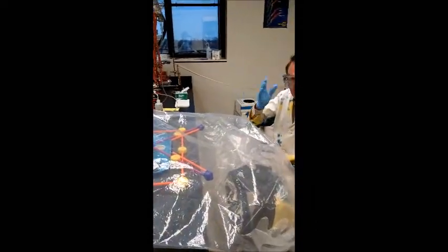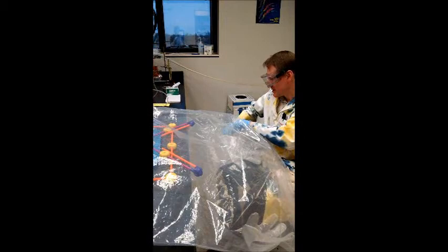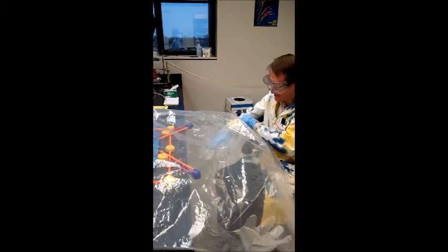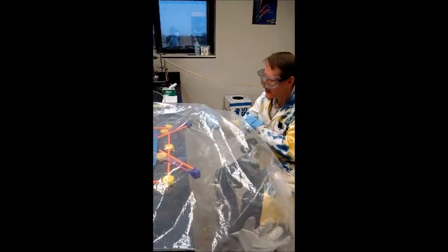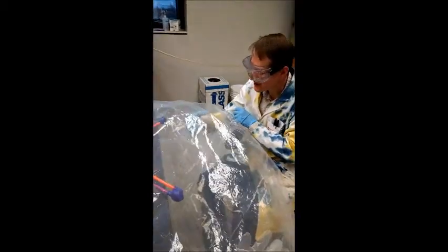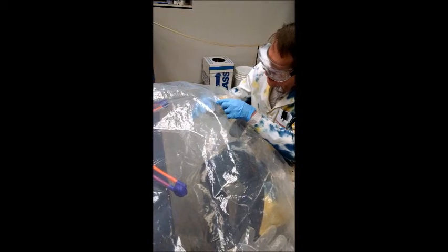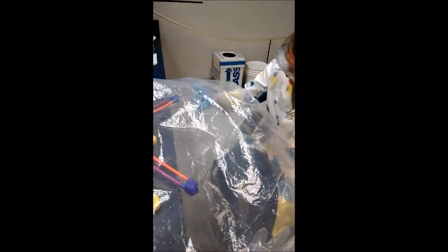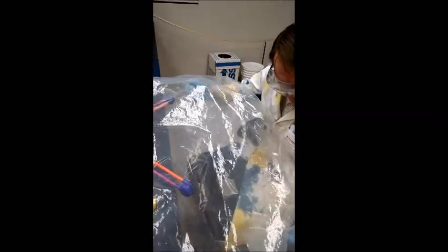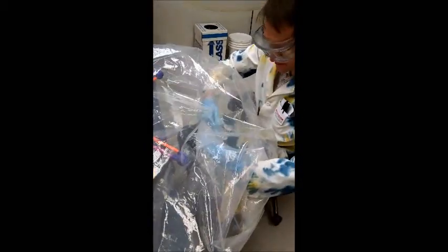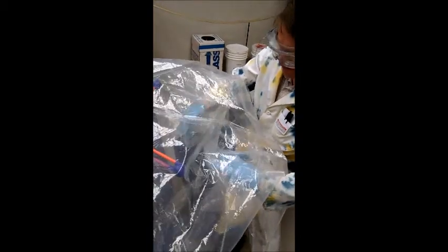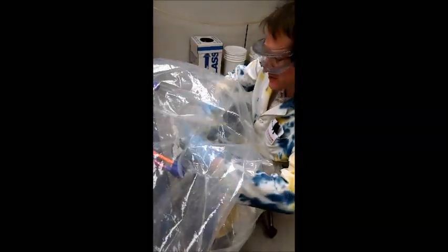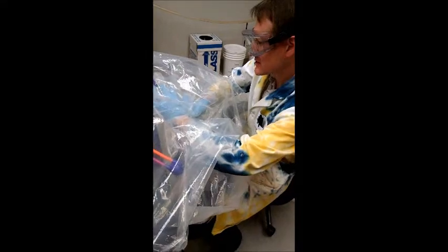Go ahead and continue to wear safety equipment just in case the bag bursts. You can see the gloves are one size fits all. Looks like we have a leak in our glove here so that's not good. You want to inspect the gloves in the bag to make sure you don't have leaking.